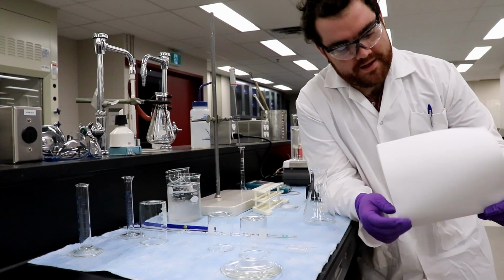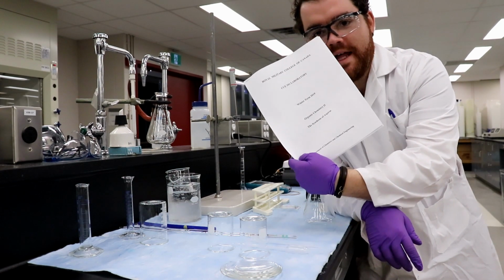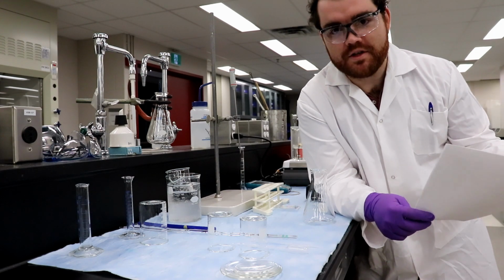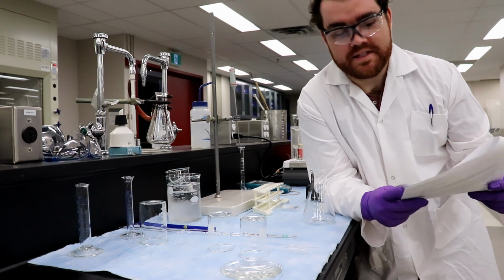And we're going to be making some drugs today. We're going to be synthesizing some aspirin today. So, here's the lab manual right here in front of us. And just like last time, Ingrid knows exactly what's going on. I have no clue. So we're just going to go through the manual and see what happens.